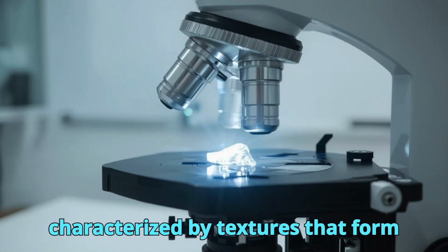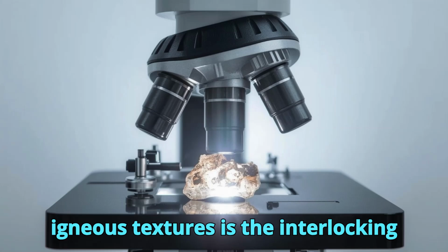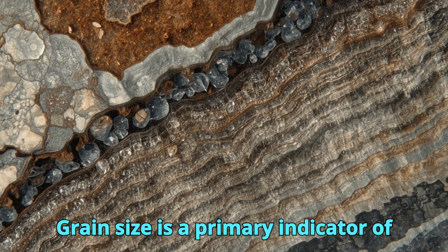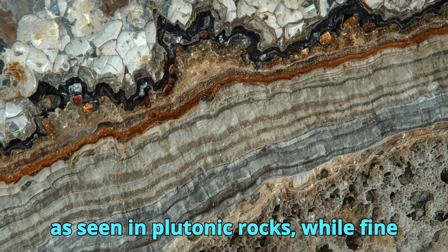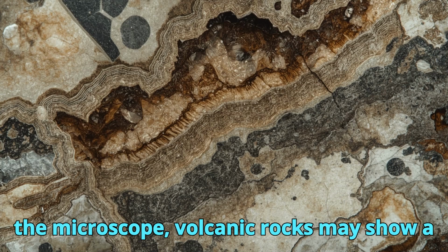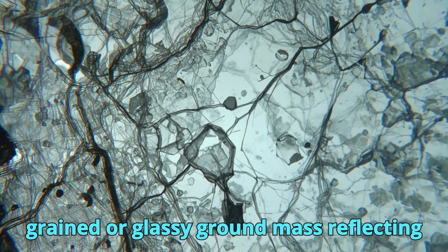Igneous rocks are characterized by textures that form during the crystallization of magma or lava. One of the most fundamental igneous textures is the interlocking crystalline texture, in which mineral grains grow together without pore space. Grain size is a primary indicator of cooling rate. Coarse-grained, phaneritic textures suggest slow cooling at depth, as seen in plutonic rocks, while fine-grained, aphanitic textures indicate rapid cooling in volcanic environments. Under the microscope, volcanic rocks may show a porphyritic texture, where large, well-formed phenocrysts are embedded in a fine-grained or glassy groundmass, reflecting a two-stage cooling history.